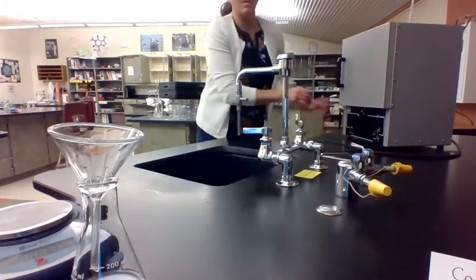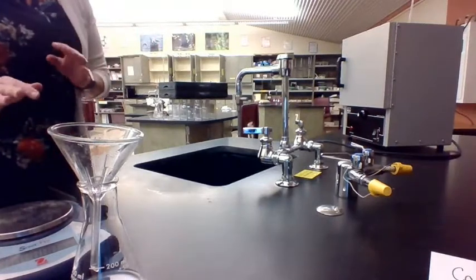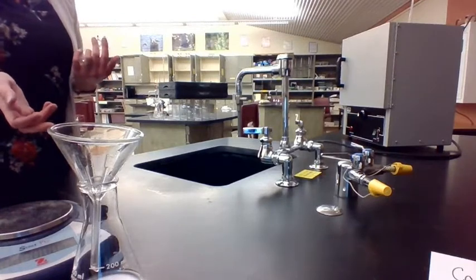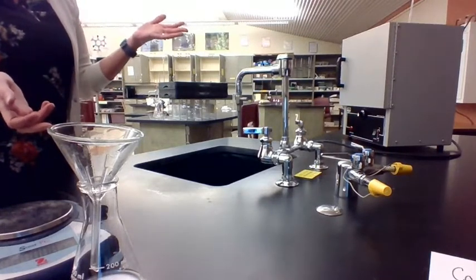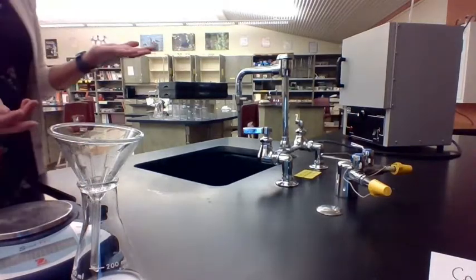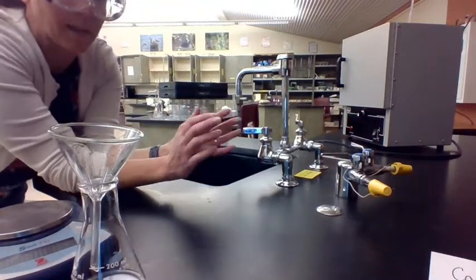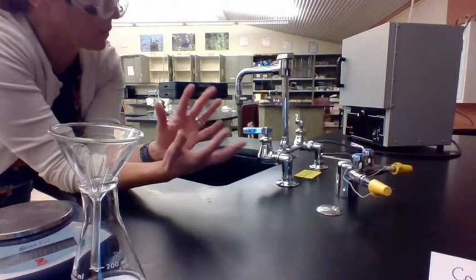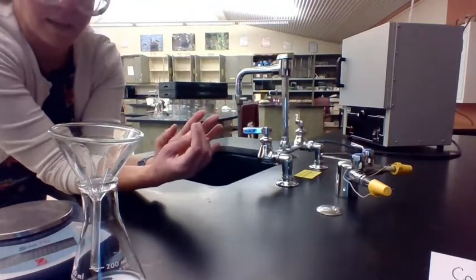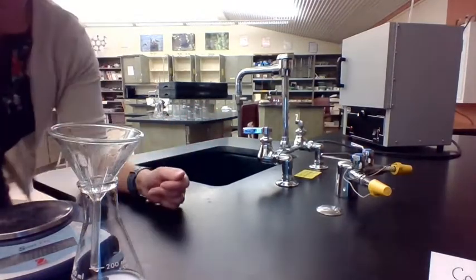And ideally, we would dry it and weigh it and then dry it again and weigh it again. That's called heating to a constant mass, and that is the goal here. And you can see why we weighed the filter paper first. It's because that solid is stuck on the filter paper pretty well. So at the end, when we weigh it, we're going to have a mass of the solid plus the filter paper stuck together. And then we're going to subtract the mass of the filter paper to figure out how much of the pure solid we made. So we'll come back when it's dry and we will weigh the pure solid.